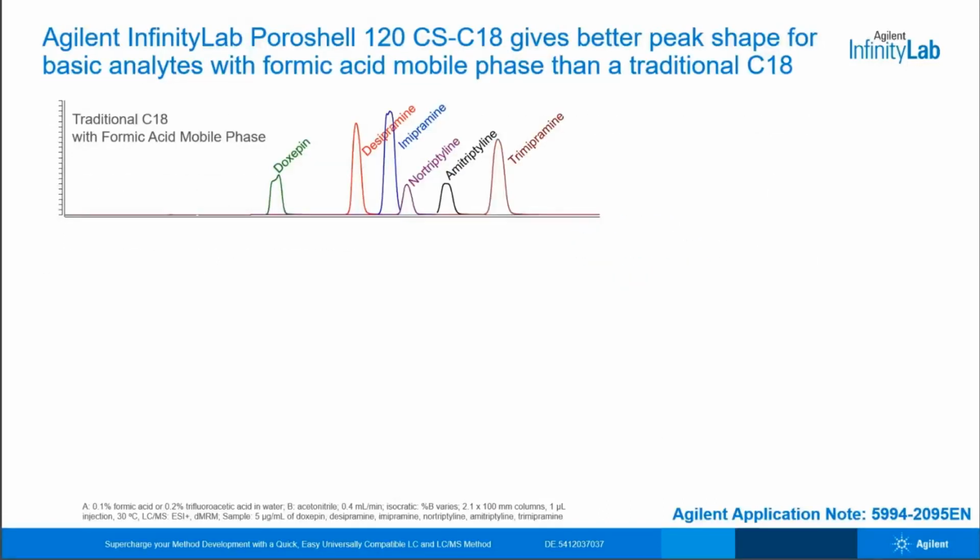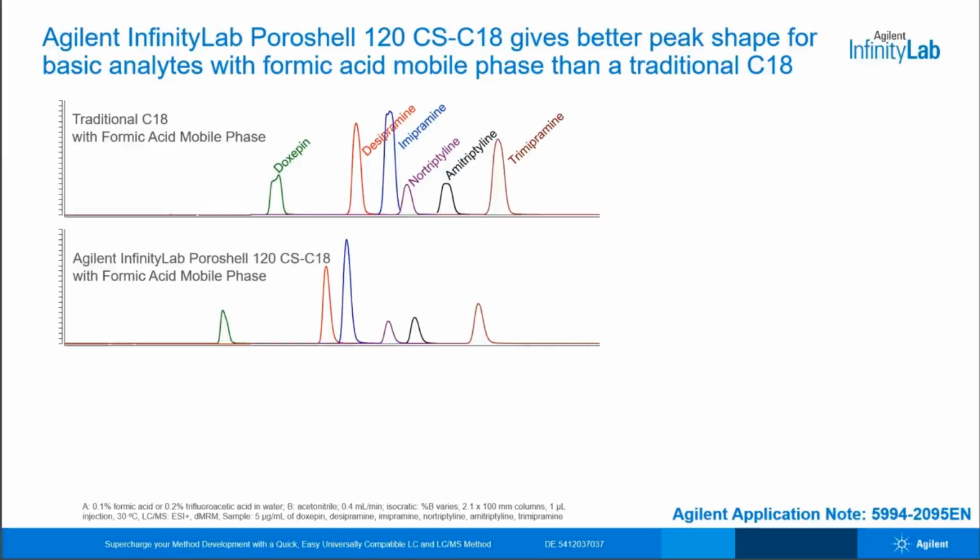Here you can see the potential peak shape issues for basic compounds with formic acid. This is a separation of tricyclic antidepressants, which are well known for their troublesome peak shape on a traditional C18 column with the formic acid mobile phase. These compounds often tail, but in this case you can see they are broadened and splitting. However, if we use the appropriate column bonded phase for this situation, we can overcome the peak shape concerns. The InfinityLab Poroshell 120 CS-C18 is designed just for this. It provides good basic compound peak shape with low ionic strength mobile phases like formic acid.